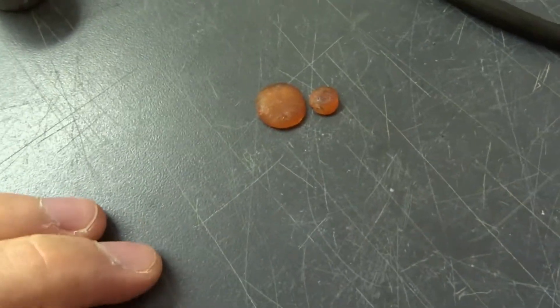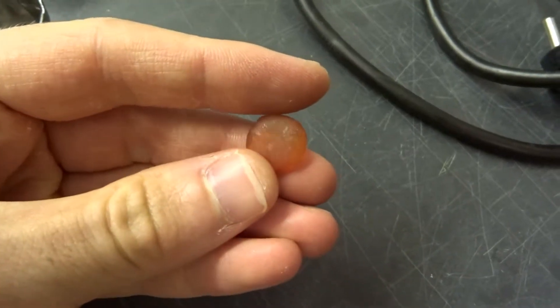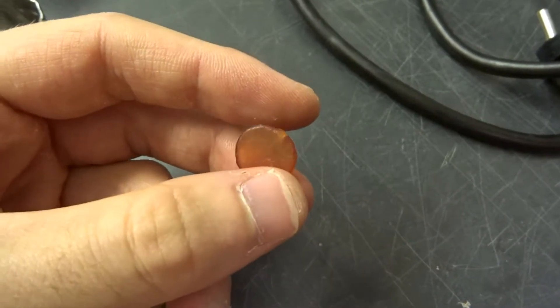Hi and welcome back. Today I'm going to test my Bakelizer. These are some pieces of Bakelite I made around two months ago.